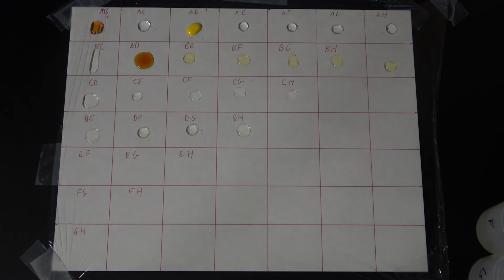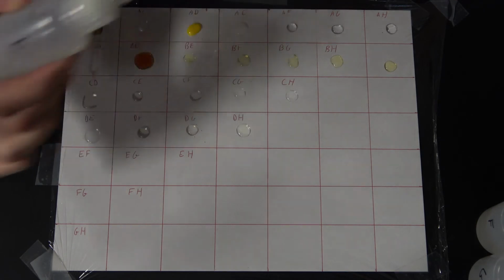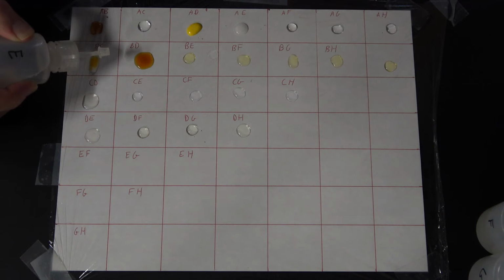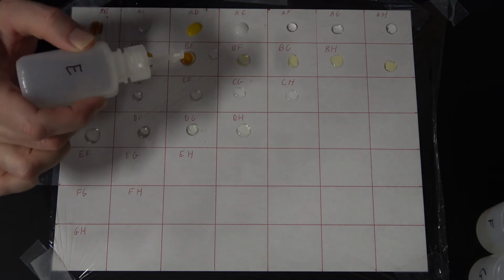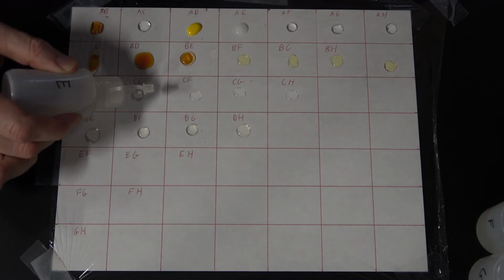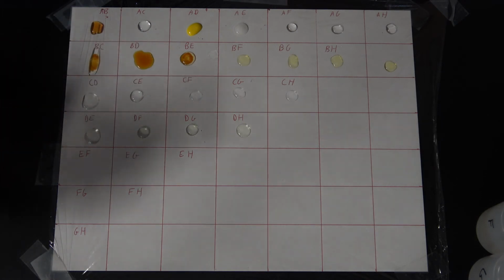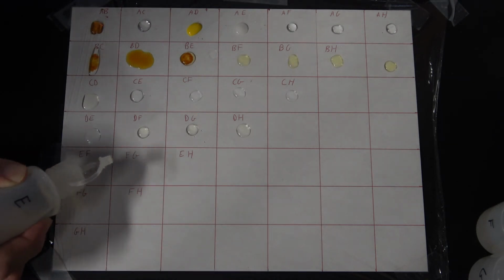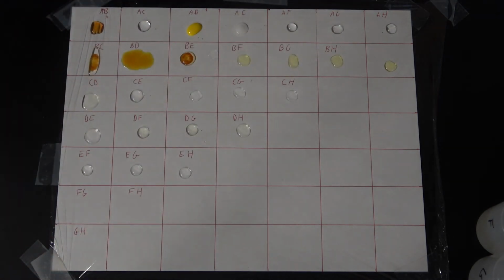All right, now for E. Stray little drop from E, disregard that. I messed up and put E in the B, C. Just goes to show you that even chemistry teachers can mess up when they're not paying close attention. A good lesson, and I'm going to leave it in the video. Also, I don't want to take the time to set all this up again.